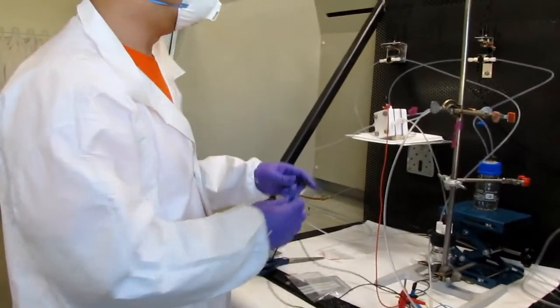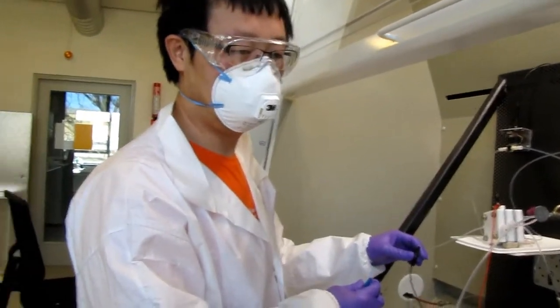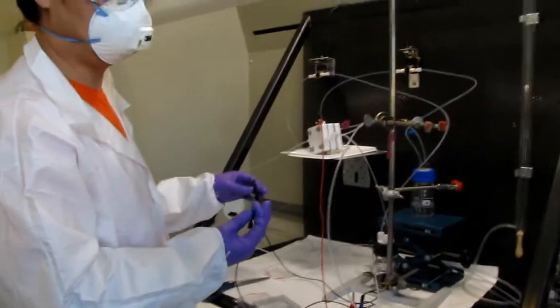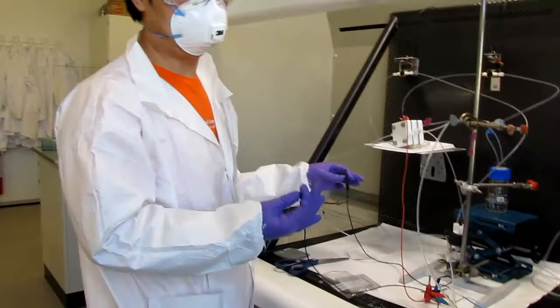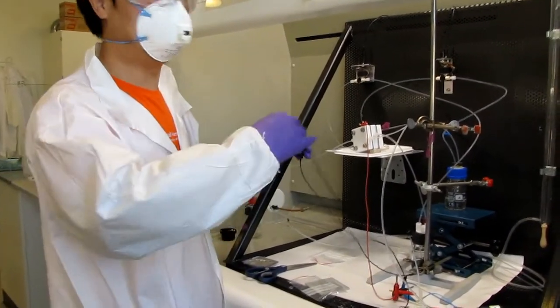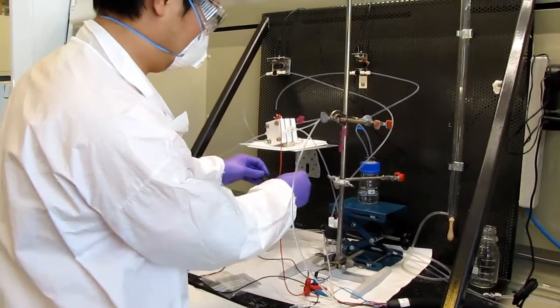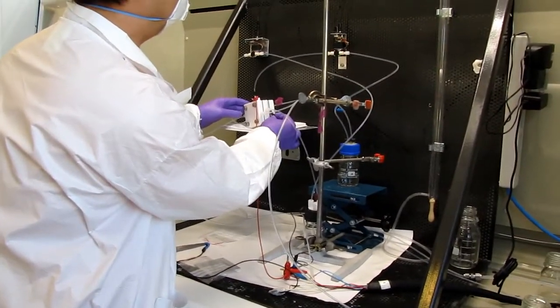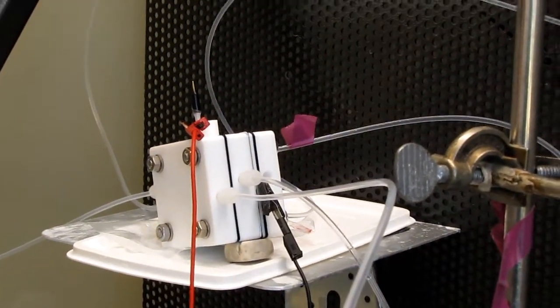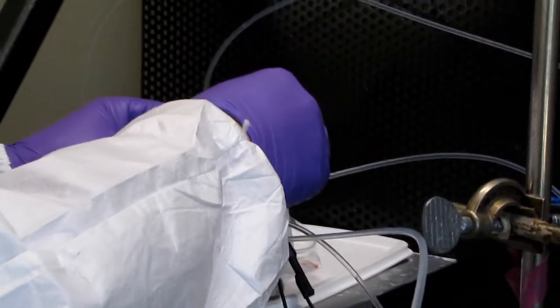Because sometimes the GC doesn't have an exact linear line — it should be, but... You have two different ones, 50 and 100. You should have a linear line for TCD. But most TCD doesn't have the exact linear line. Theoretically it should, but especially if you have very high concentration or very low concentration, it doesn't fit the linear one.